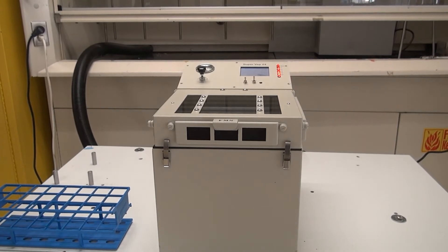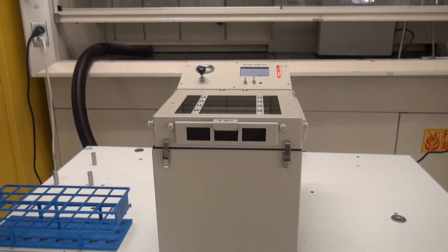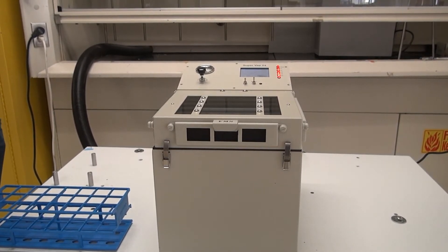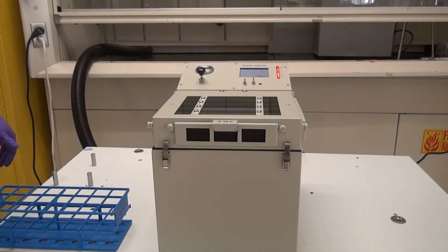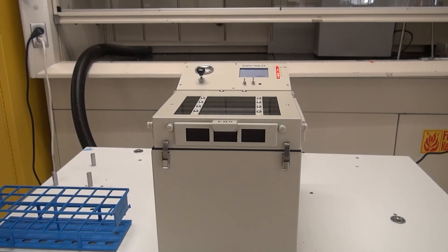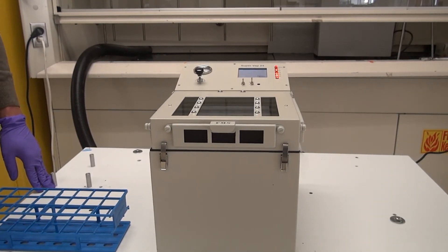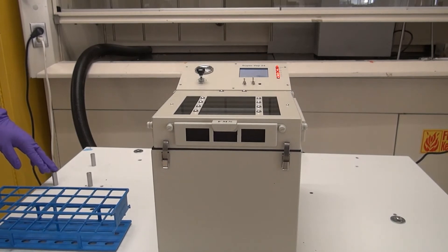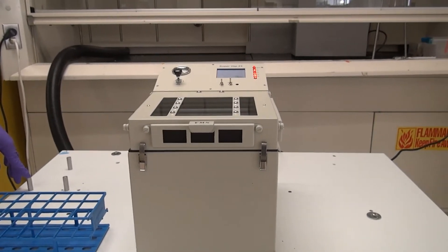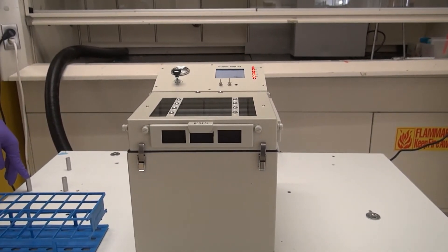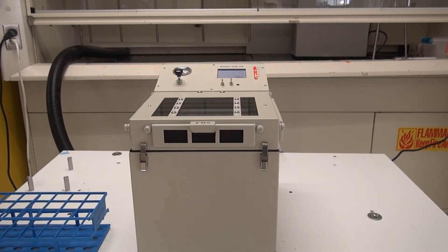These start to finish anywhere from 60 to 70 minutes to complete dryness, and it does vary because it depends on how dry you get your extract. If there's water in your methanol then water is definitely going to take longer to evaporate from this system. So we'll come back at different times and show you the different levels.